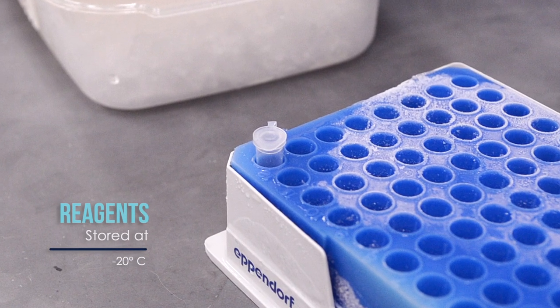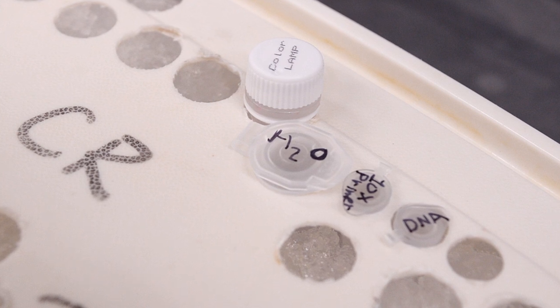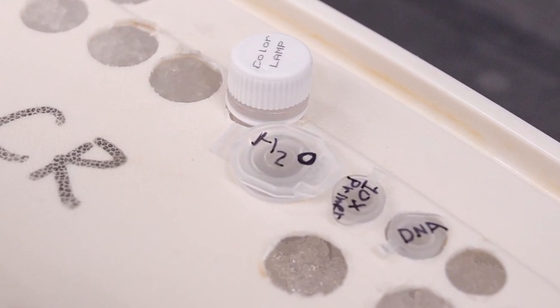All LAMP reagents are stored at negative 20 degrees Celsius. Our water, DNA, and 10X primer mix have been thawed at room temperature and placed on ice.